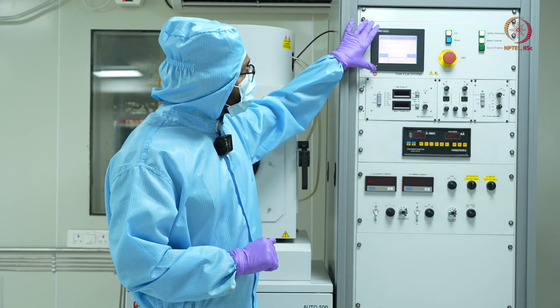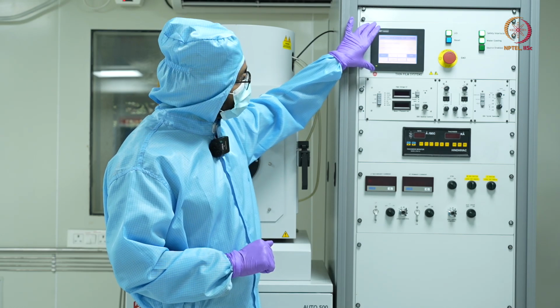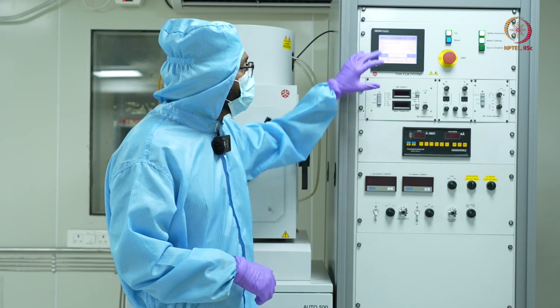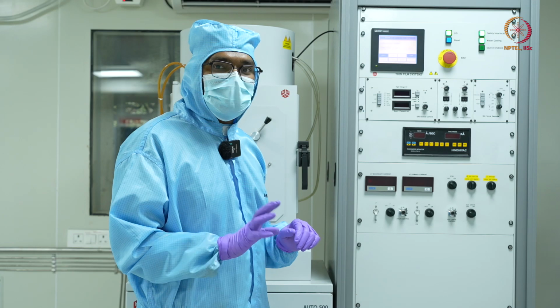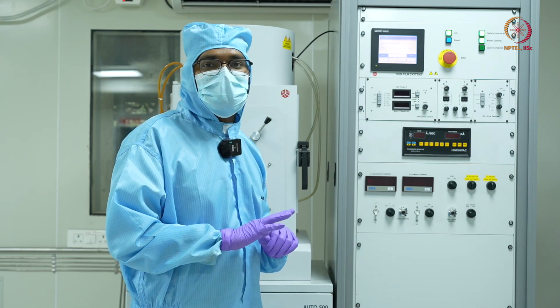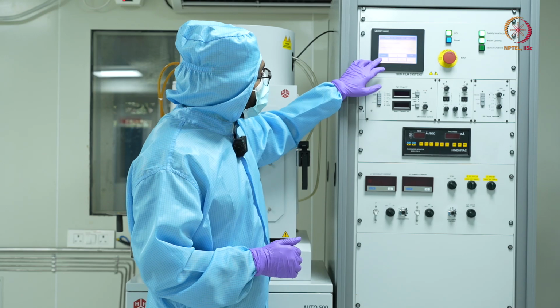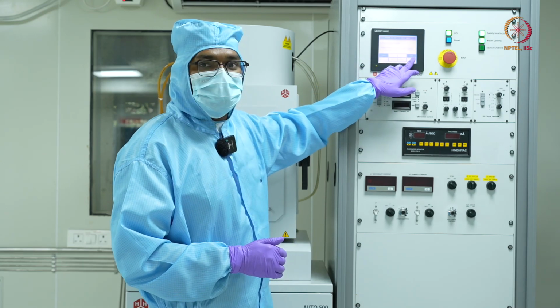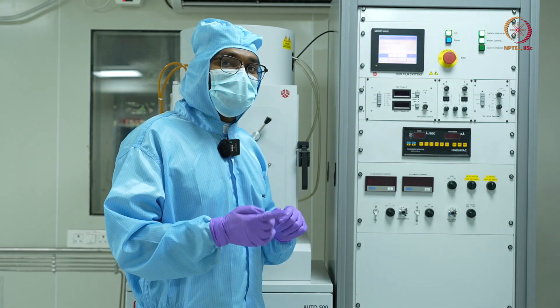Now we can see here this panel. Okay, this is the panel which also acts as a display as well as input. So at this interface, we can see the system status is standby. That means my pumps are not running, nothing is running right now. It is just sitting idle. Okay, now I have two options here. One is start and one is vent. There are multiple options, but the options which are available to me are start and vent.